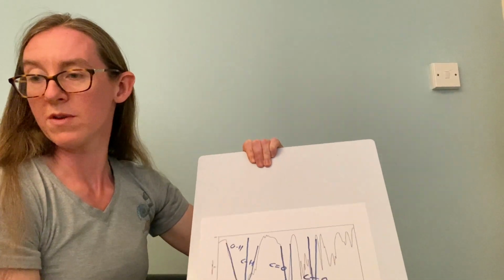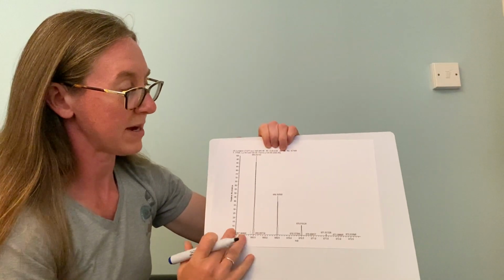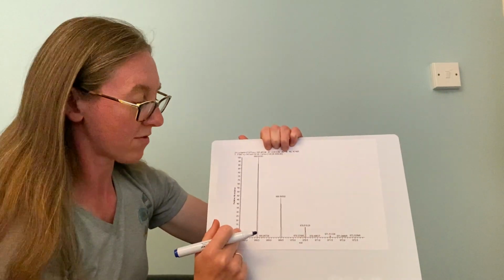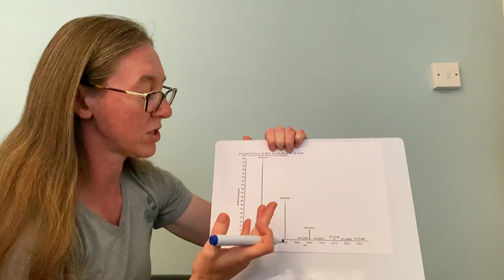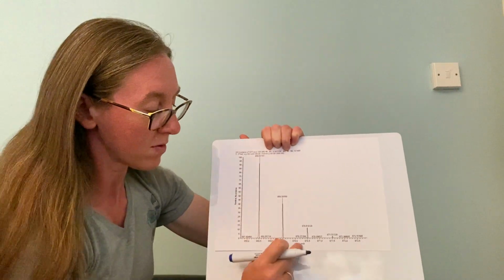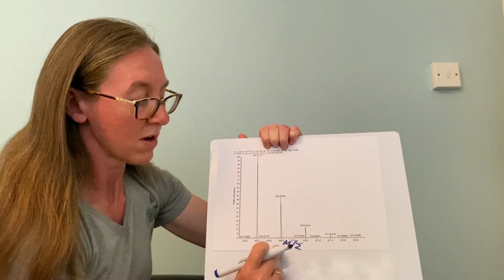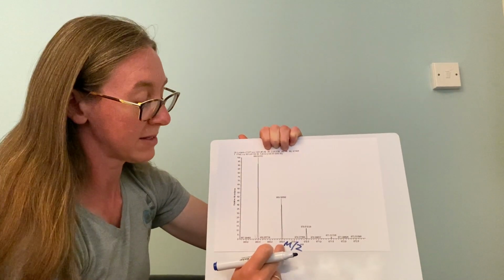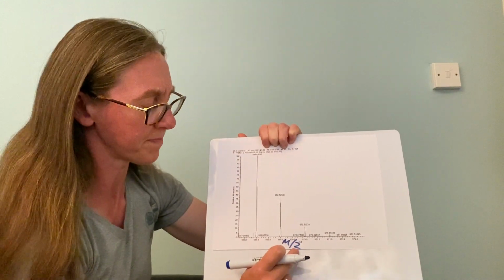So next up, we've also previously had a look at mass spectrometry. And so this is our mass spectrum, so more of a kind of graph with peaks on it. So this is relative abundance, which is essentially how much you've got of each peak, which doesn't really tend to matter very much for us. Along the bottom, this is M over Z, which they often write as the mass to charge ratio. So M stands for mass, Z is the charge of the ion, which we assume is +1.